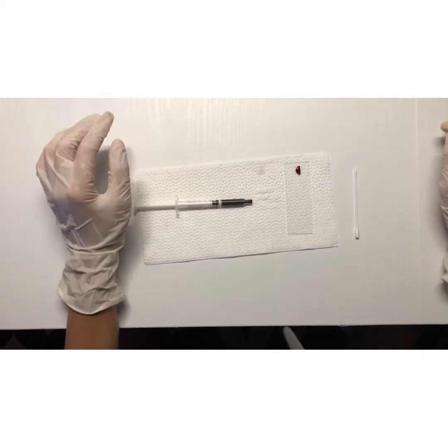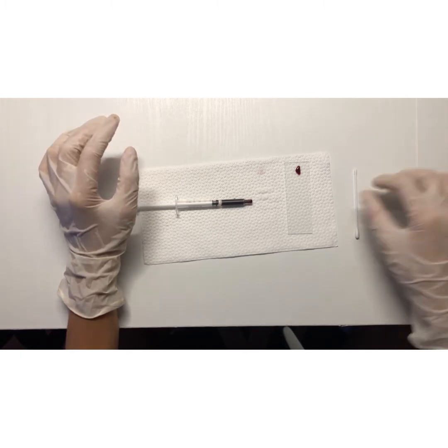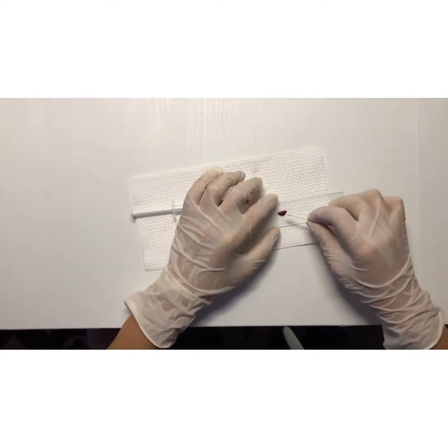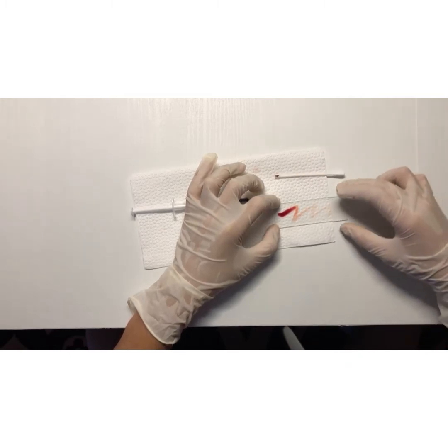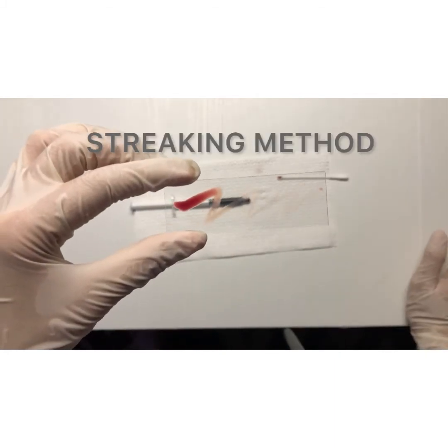Then, in a zigzag manner, I will streak the specimen up until the whole end of the slide. And this is now the streaking method.